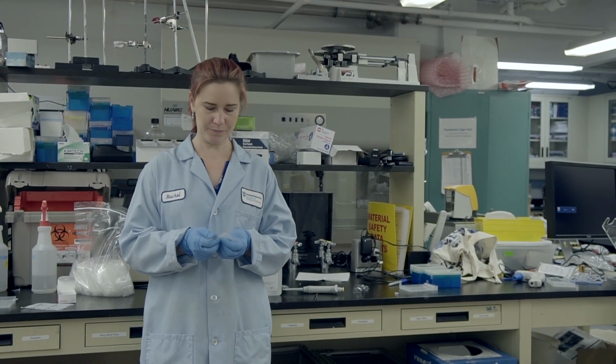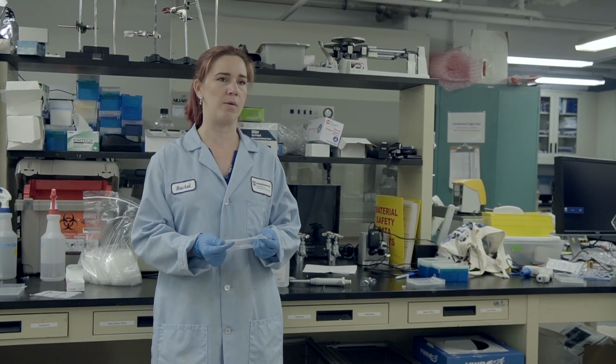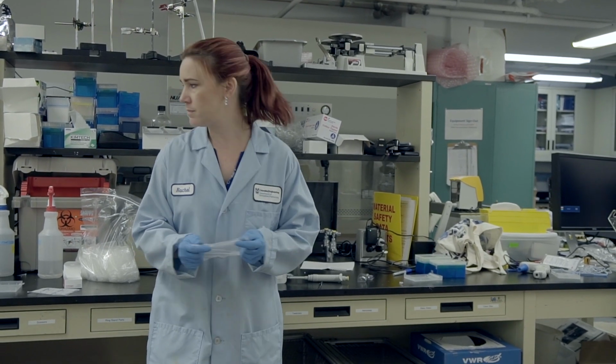It gets underneath a little bit, you'll just peel it off. But if you ever do use it, you'll go through training, and there'll be very strict protocols.